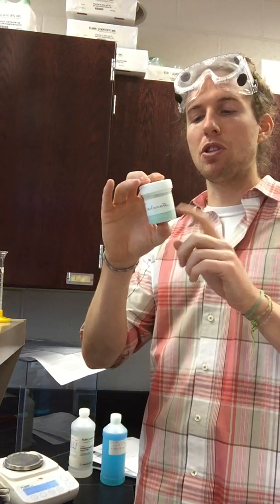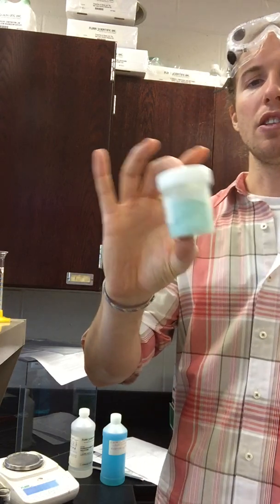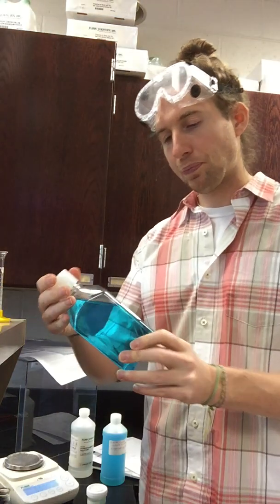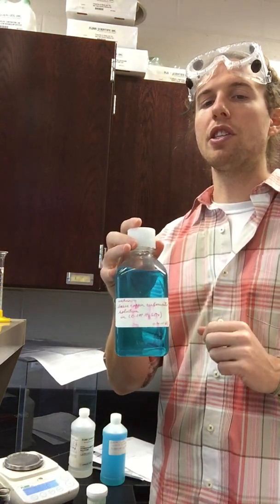And in the pre-lab, you saw there are 2 options for the unknown copper carbonate solution. You can see this is just a little powder. And so we want to figure out what compound is actually in here. Then in part 2, we've got a different one. This one is copper carbonate as well, but this is a different solution. So this is going to be for part 2 of the lab, and we'll see that in a moment.